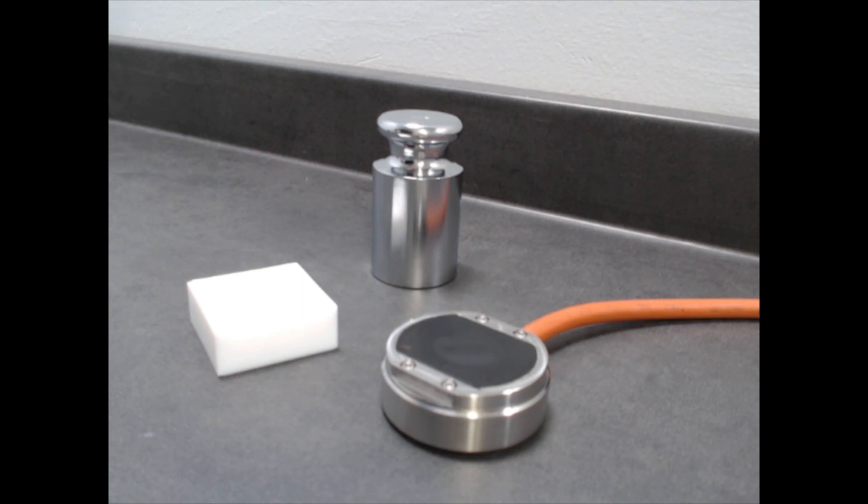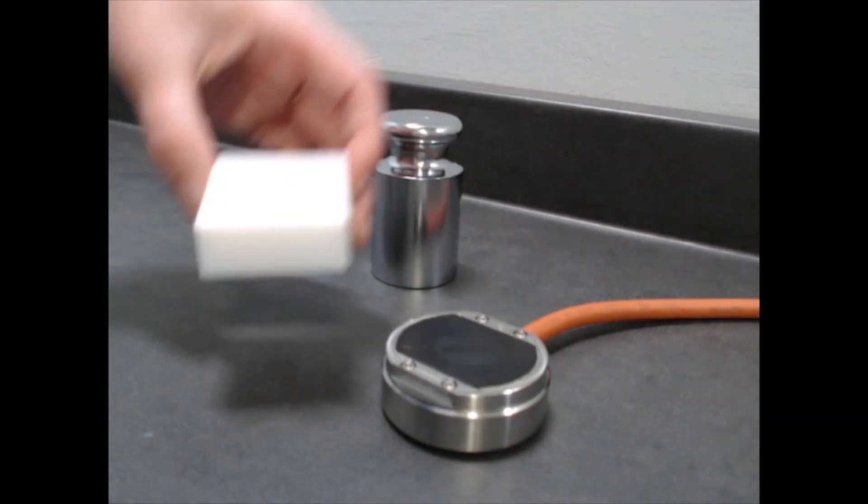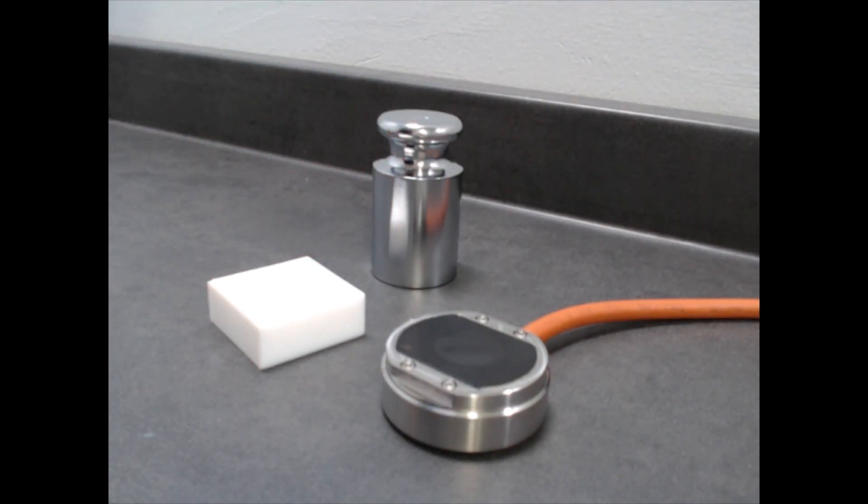In this video we're going to be using our MTPS sensor for testing a single piece of Teflon. The MTPS sensor is an absolute single-sided sensor for testing solids, paste, and powders using the MPV, which is the measurement platform versatile.